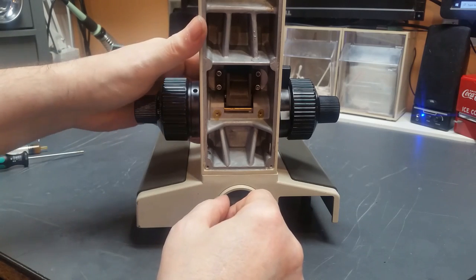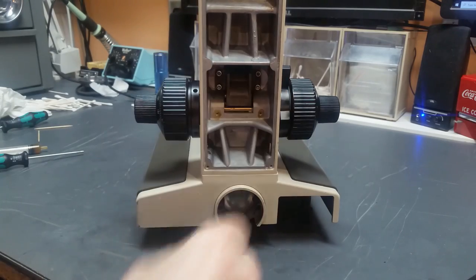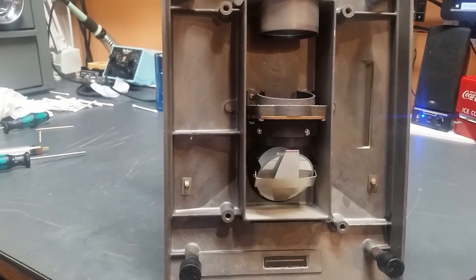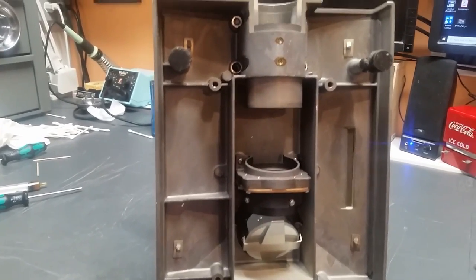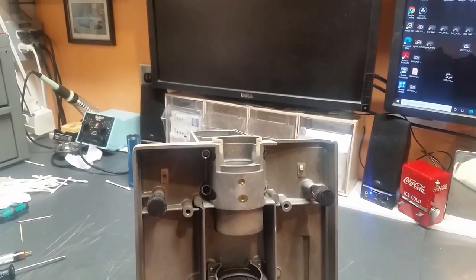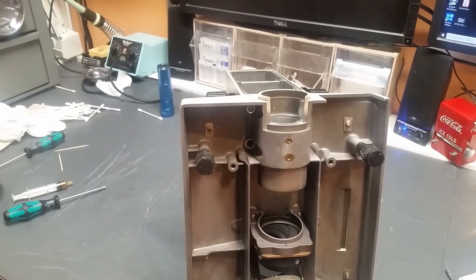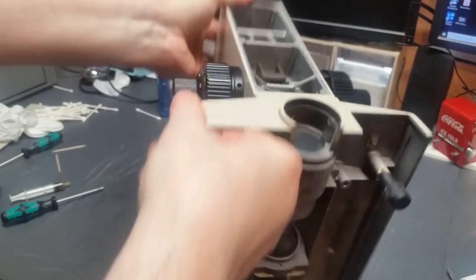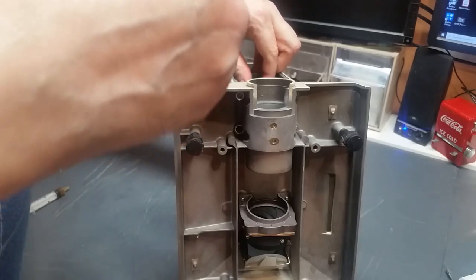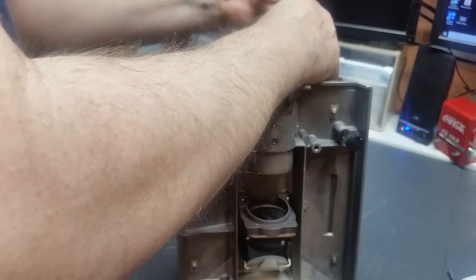And in order to do that, the easiest way right now, I've got gravity working against me because the sliding focus block is pulling down on the gears and it's binding this and holding that. What I'm going to do is set it up on its nose. And at that point, well, you probably really can't see it. But I'm going to do exactly what I said I'm going to do. I'm going to align that thing so that the gearbox is centered. You're not going to see it so much, but just be smug in the knowledge that that's what is happening. Okay. So at this point, yeah, now the thing moves freely. Okay. I'm going to snug all four screws down.